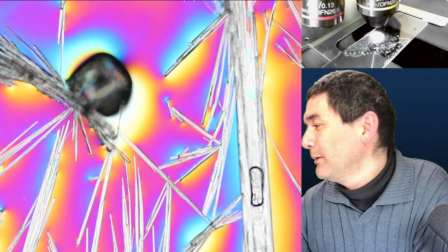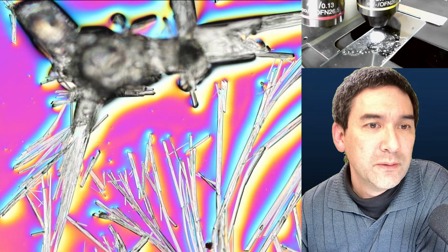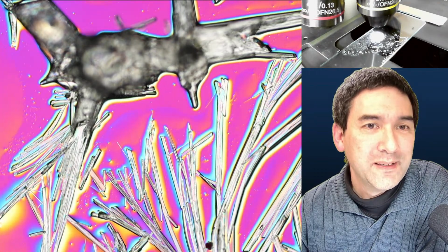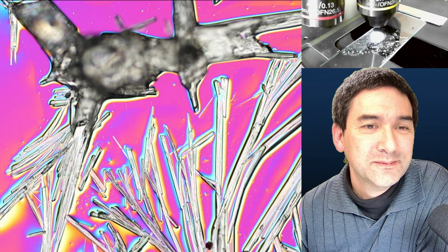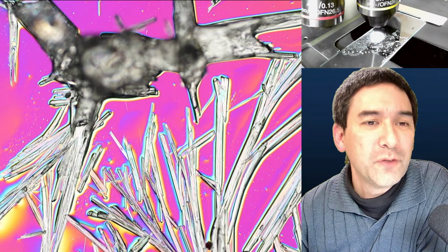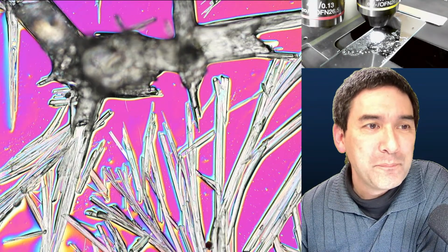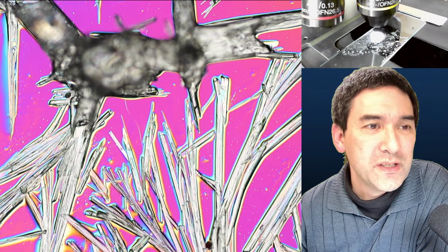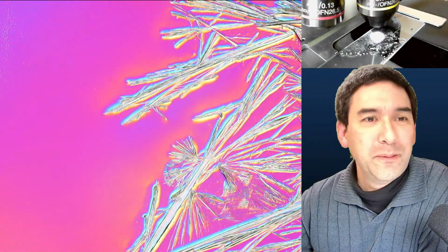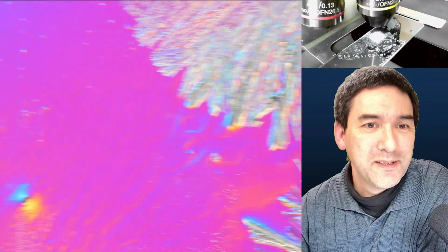Because alcohol evaporates so quickly, maybe we're able to see the reforming of the crystals as well. Yep, do you see? Some of them are growing back again. So that's actually an advantage when you've got substances that dissolve in alcohol, because the alcohol evaporates so quickly. Therefore, you're able to see the crystallization process much faster. That's nice. Look at this. It's not time lapse. It's in real speed.